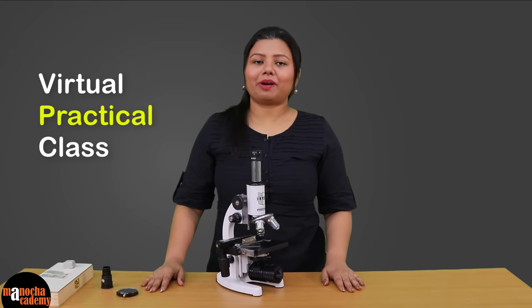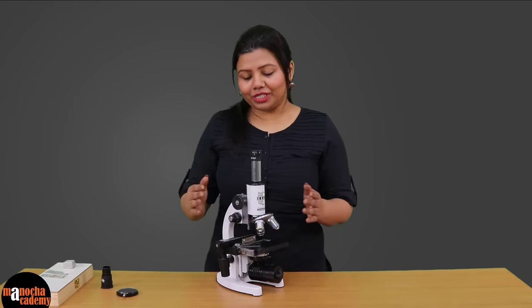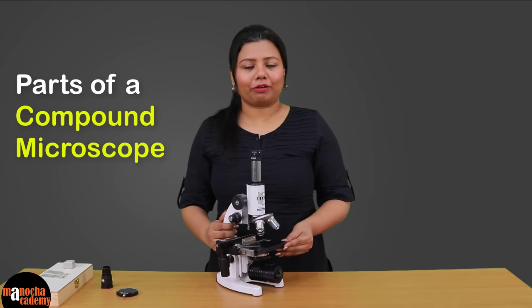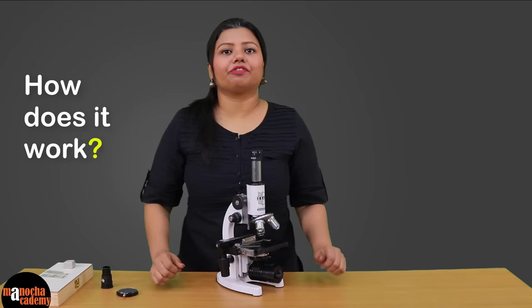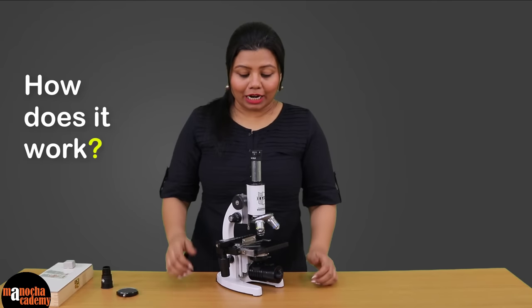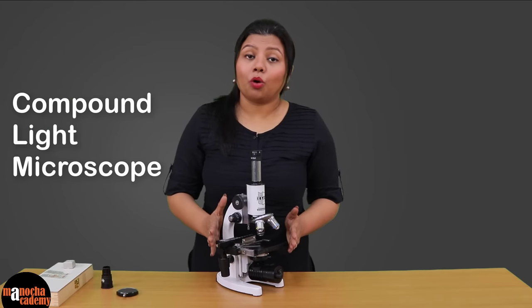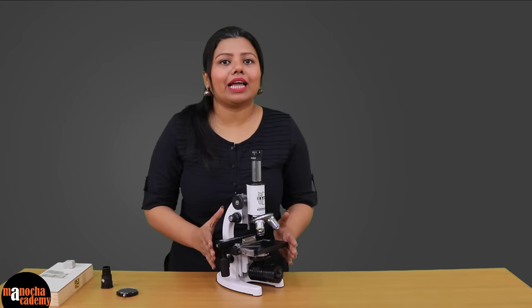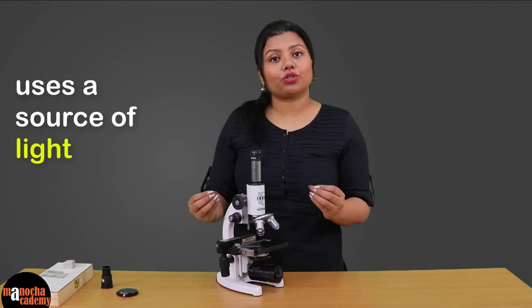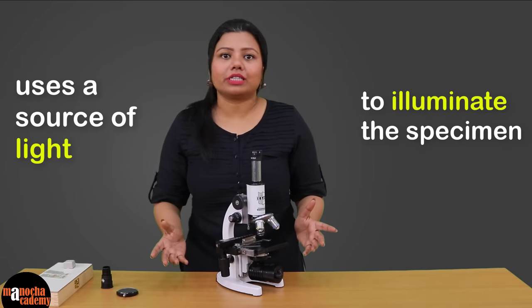Hello everyone, welcome to the virtual practical class of Manocha Academy. In today's class we are going to see the different parts of a compound microscope and we are also going to talk about how the different parts work. This is a typical compound light microscope. It is called a light microscope because we use a source of light to illuminate the specimen that we are trying to see.